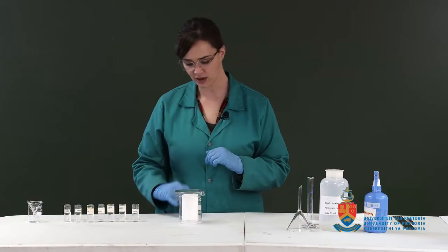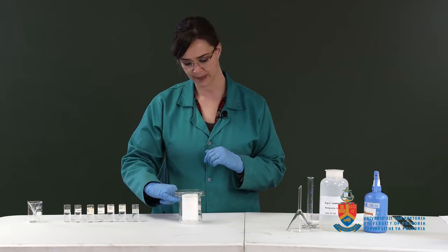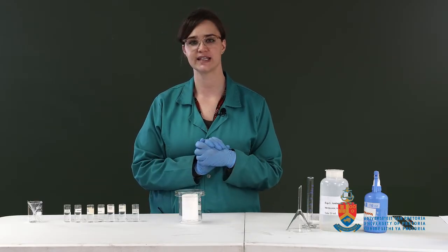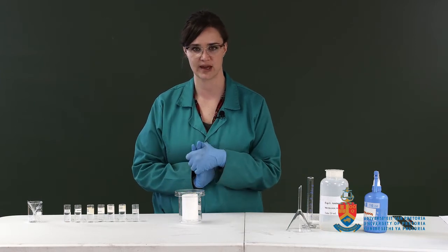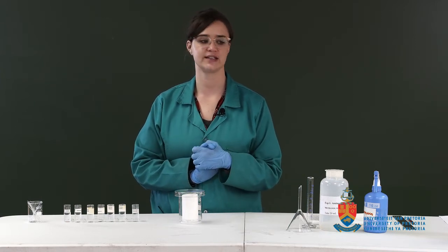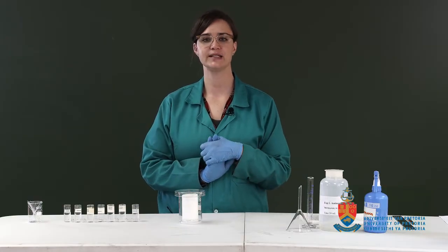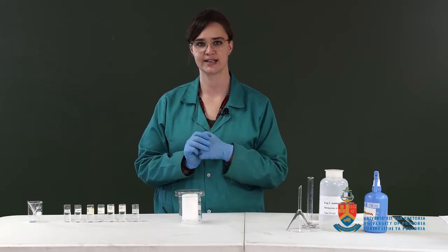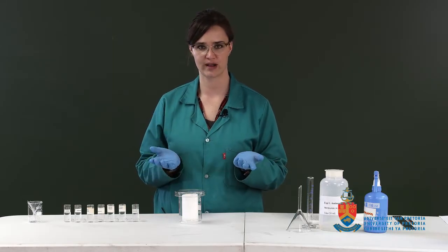You will see the solvent front moving up the paper chromatogram. Okay, so what happens here is we have a stationary phase, which in this case is a cellulose in the paper, and the mobile phase is our eluent, our methanol water mix. So what happens is each amino acid has a different affinity for either the stationary phase or the mobile phase.